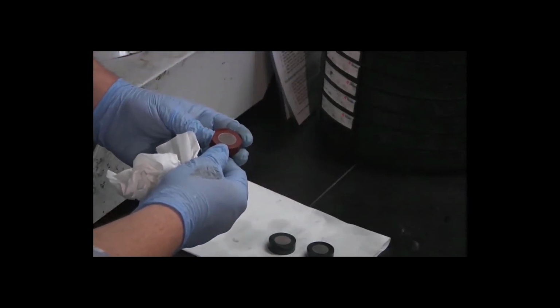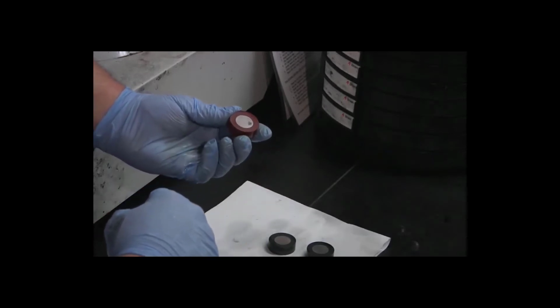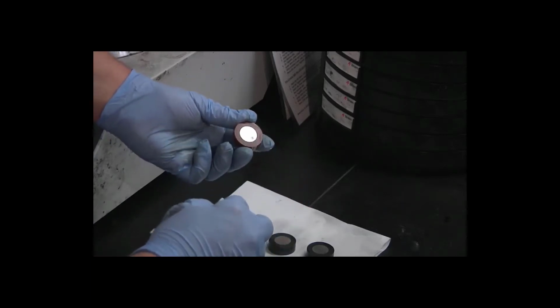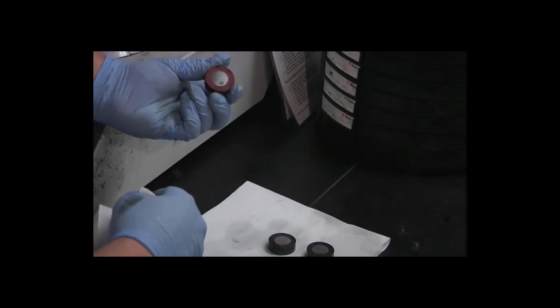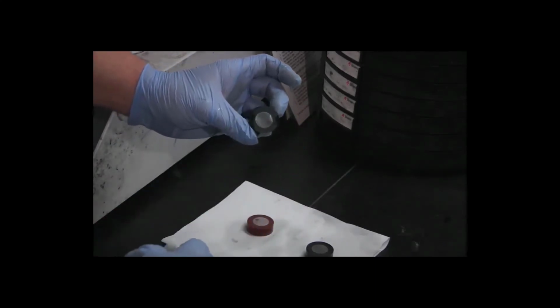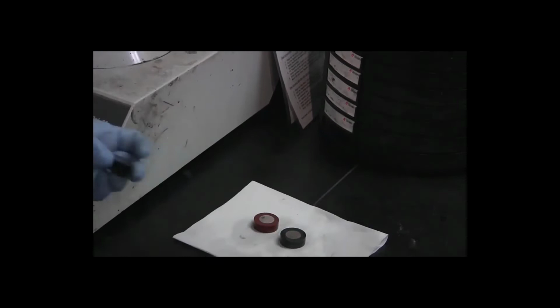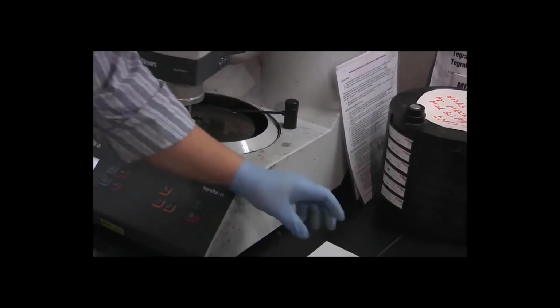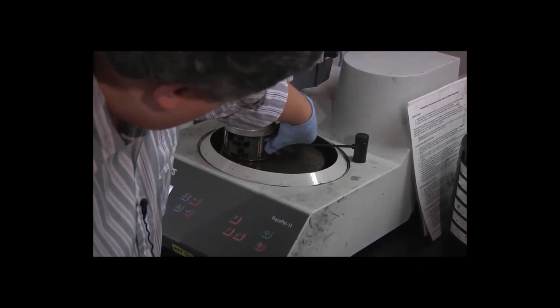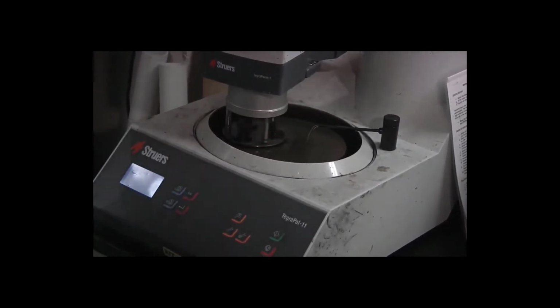And our red specimen, again, looks pretty good, except for the divot from the cutoff machine that we already knew about. So, although the goal of the previous grinding step was to not need to repeat these steps, it looks like I'm going to repeat this step just to even out the finish on our green specimen here. We'll put the specimens back in face down, and we'll repeat this step one more time, just to, again, as I said, even out the finish on the green specimen.